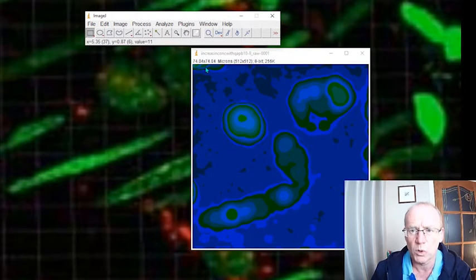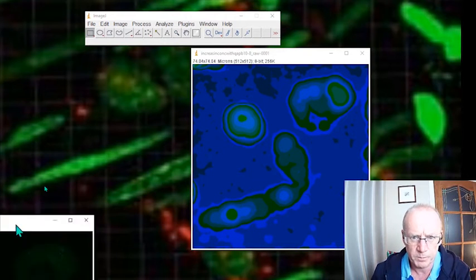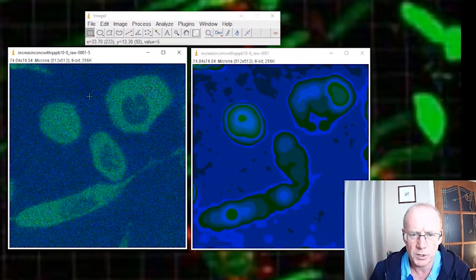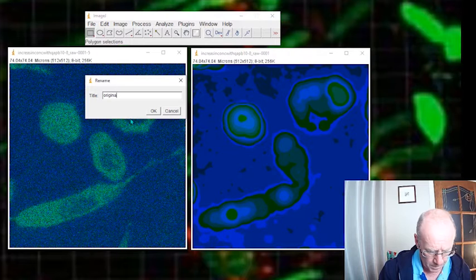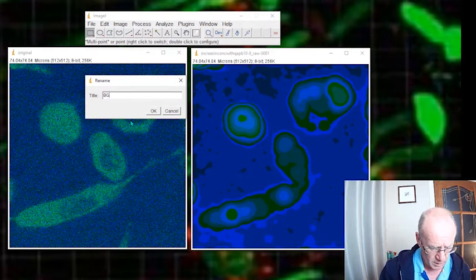Let's stick with this. Why would you want to use the background? Well, you see these holes here. What we might want to do is perhaps smooth that out a bit. Here's another copy of my original image, and let me change the lookup table. Okay, so I've got my original image on the left, and the background image on the right. I could just subtract these two images. Let me just rename this for simplicity: this is the original, and this one we're going to rename as the background image.